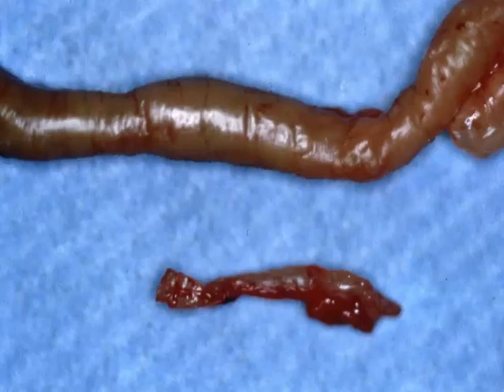and non-lactose fermenting E. coli. These atypical E. coli infections are usually seen in immunodeficient mice and may be complicated by concurrent Helicobacter infection.